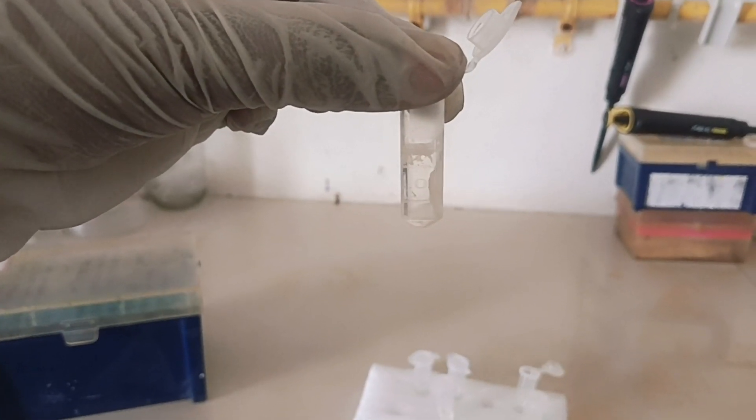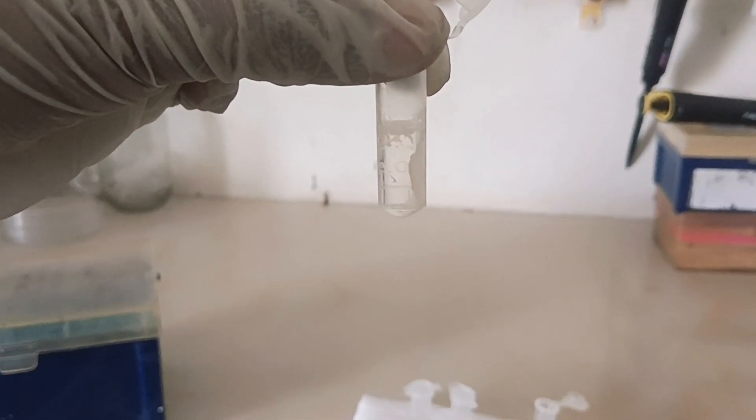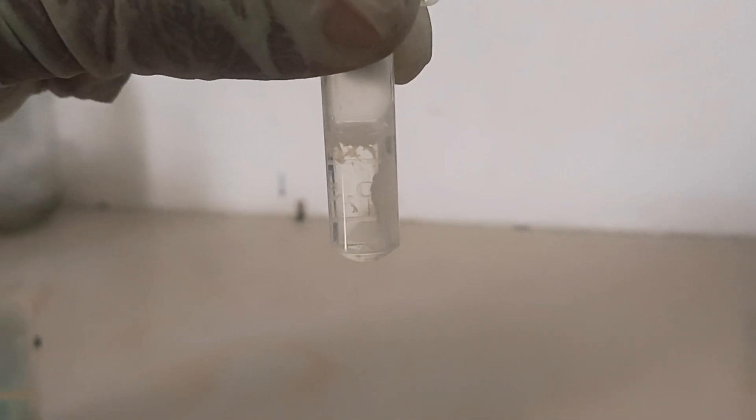After centrifugation, the upper aqueous layer is clearly visible. We will now transfer this upper aqueous layer into a new centrifuge tube.